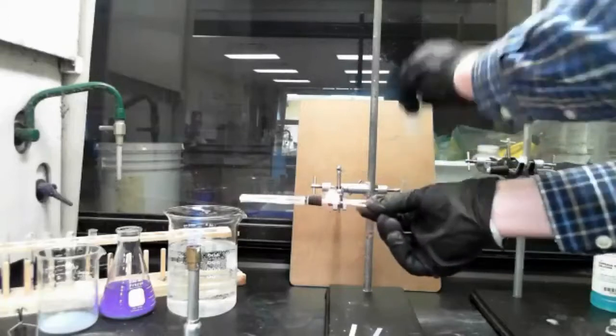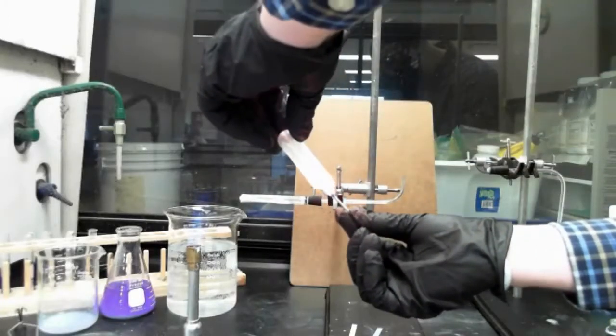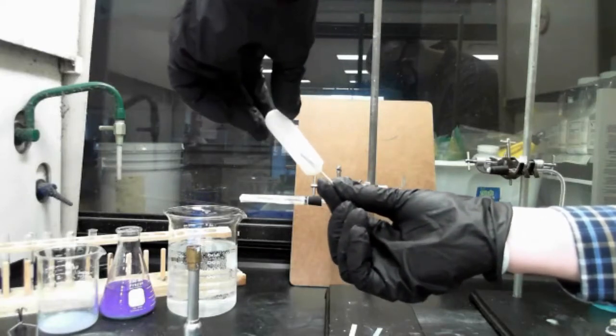So I'm going to take that, I'm going to take this, and we're going to see, does it support combustion? It does not look like it supports combustion because it all went out.